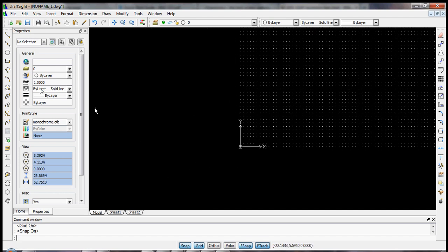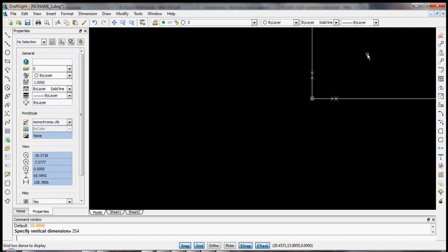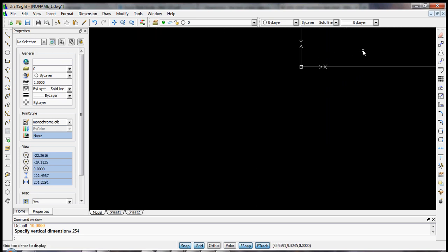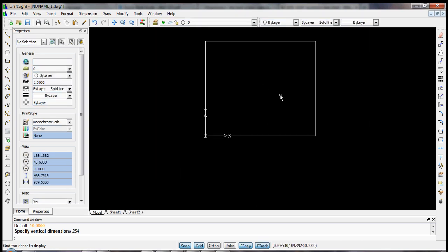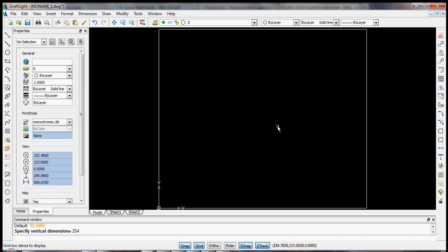Just so we can see our page, let's first draw a large rectangle that spans the entire page from 0 to here. We can again hit D and enter for defining the dimensions. Horizontal is 304.8, vertical is 254, and again use our scroll wheel to see where the bounds are. If you push down the scroll wheel, you can pan. Okay, now we see our entire page. You can also double click the scroll wheel, and that will zoom to the extent of your drawing. Okay, so this is our drawing.